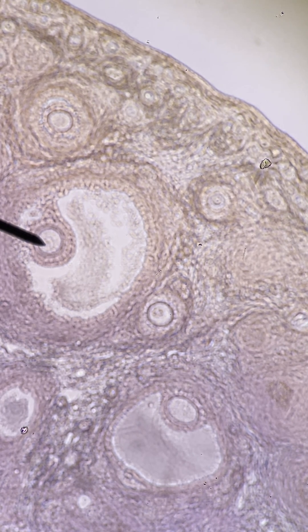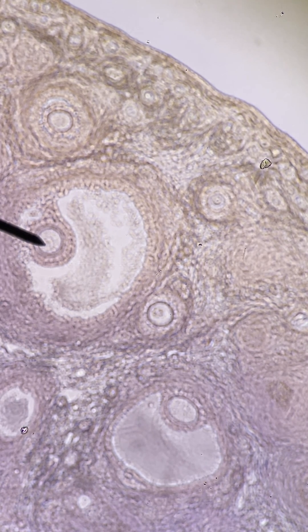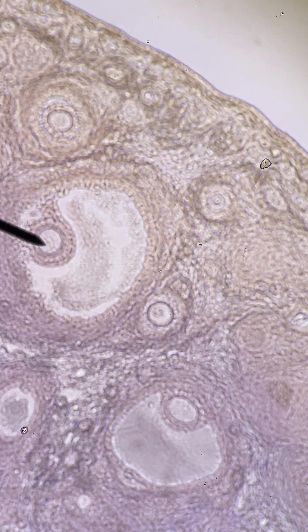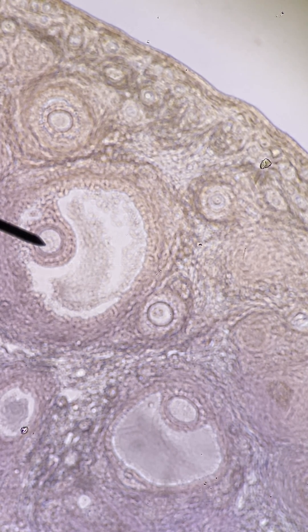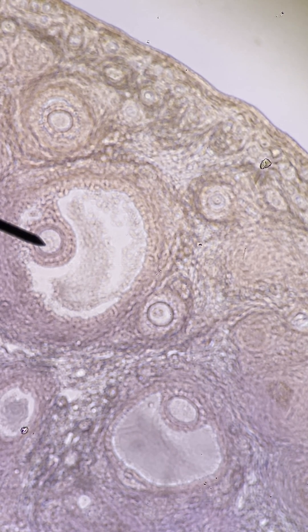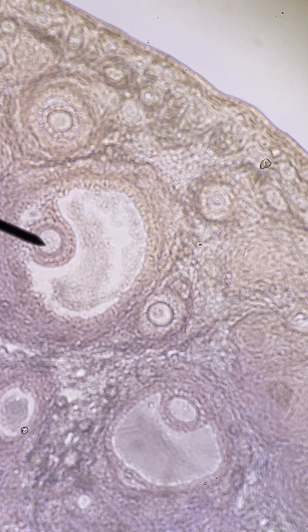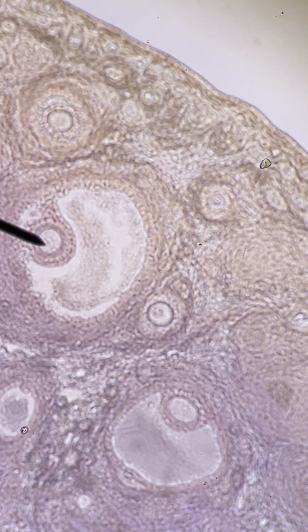By the time you get to this stage, a follicle like this will be pushed towards the outer surface of the ovary and will burst out, releasing the oocyte in the act of ovulation.